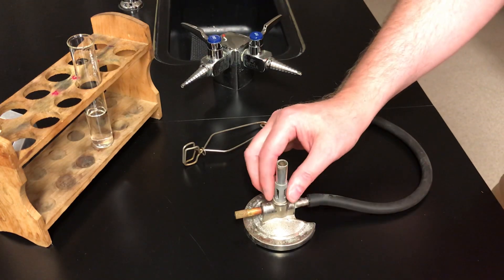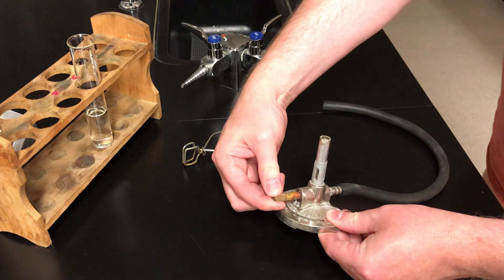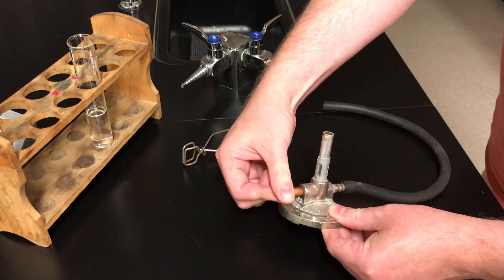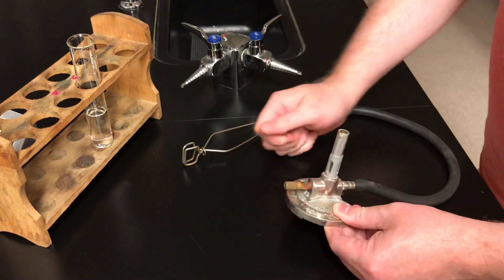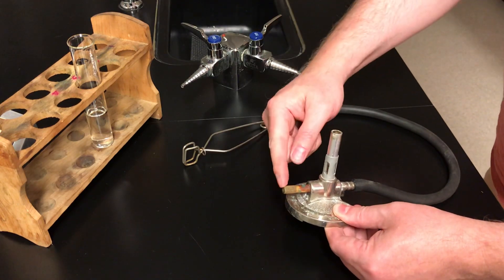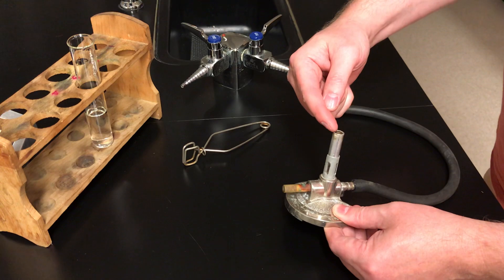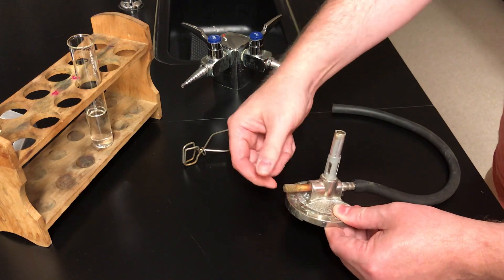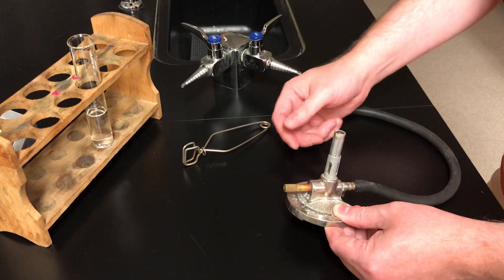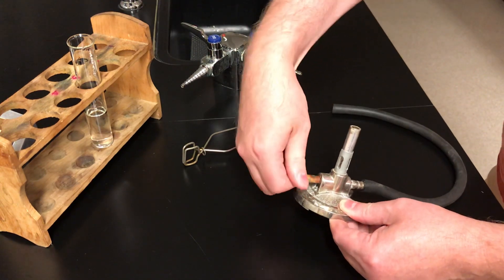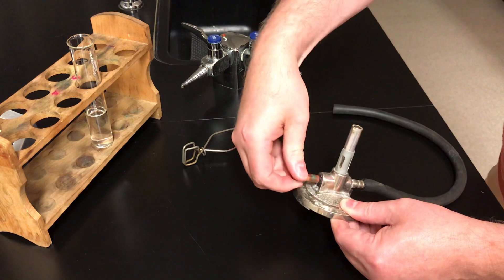When you look at the burner, you're going to notice that the base has beside it this little nozzle. This nozzle, if you turn it one way, it'll eventually turn all the way in. You can't turn it any more. That prevents the gas from coming through here. So this nozzle controls the gas. Having said that, we don't usually use it to control the gas. When you first get your burner, you want to open that nozzle.